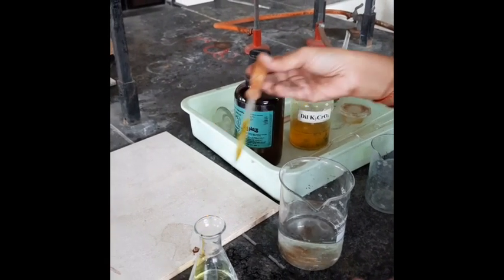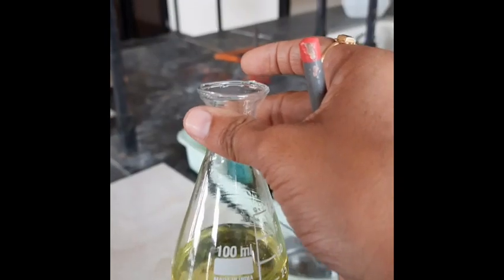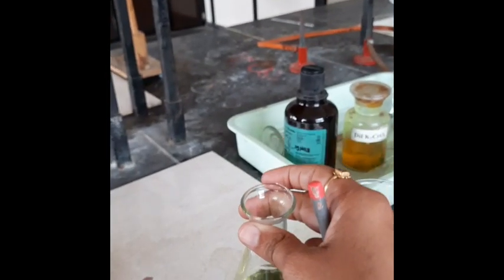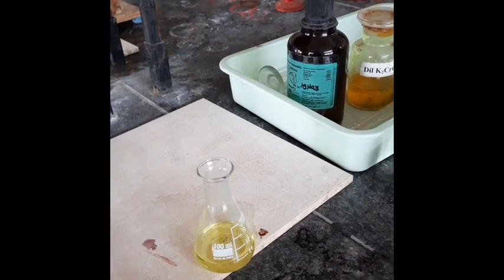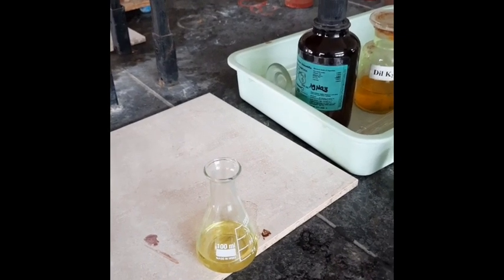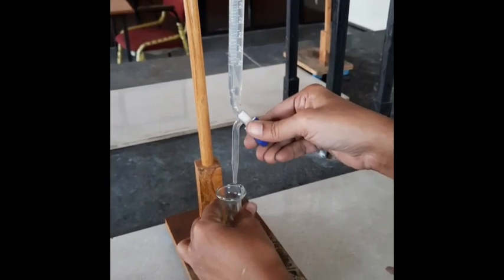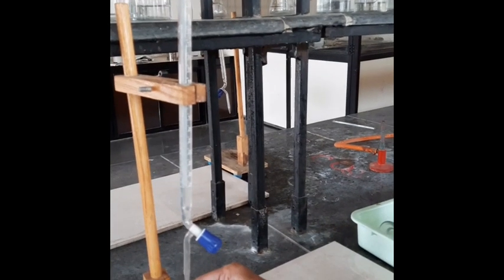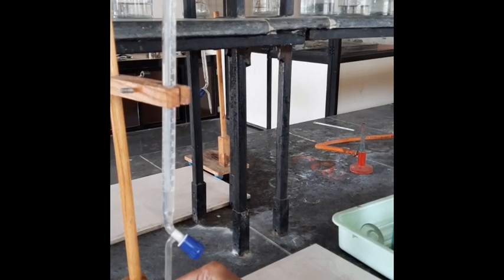Add 2 to 3 drops of that potassium chromate indicator. Now see your solution turns yellow. You have to titrate this solution with the 0.01 molar silver nitrate AgNO₃ solution which is filled in the burette. Your color is yellow — you have to titrate until its color changes to brick red. Drop-wise addition must be done with continuous shaking.